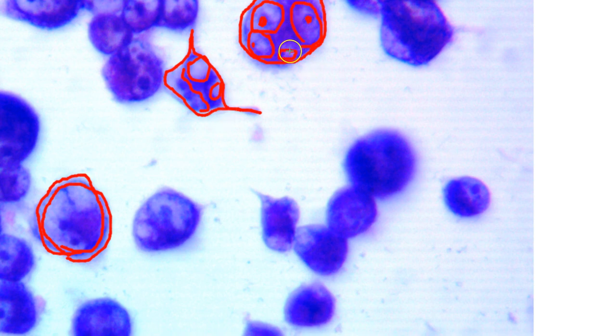So that would be an example of a dying cell. But the majority of these cells, if you look at them, are going to be either dying or stalled and arrested. The majority of them were stalled and arrested, and then obviously some of them are dying. This one has no discernible nucleus inside. It's going to be dying, or it is dying at this time.